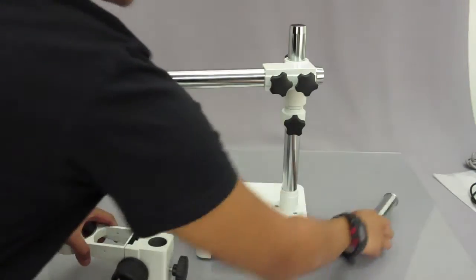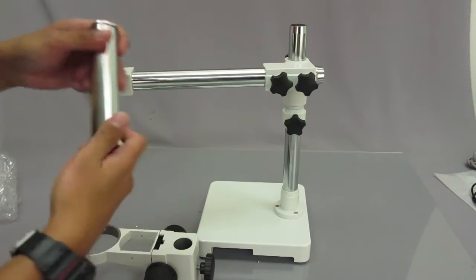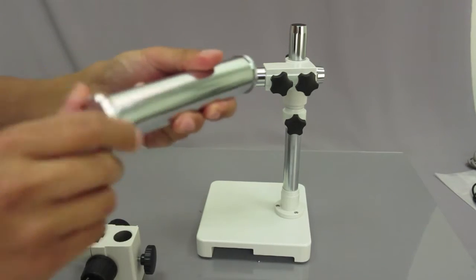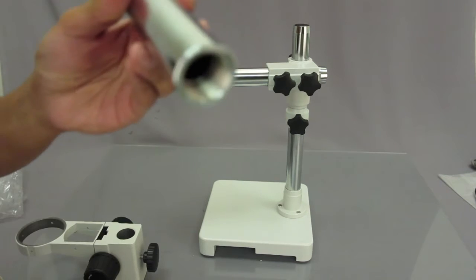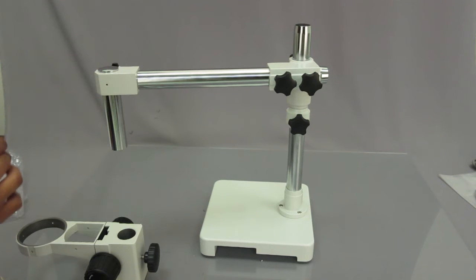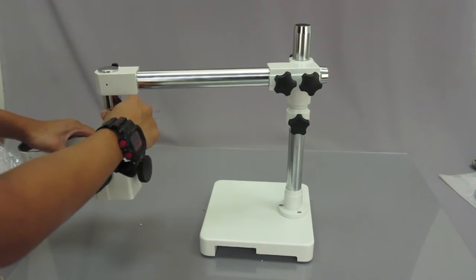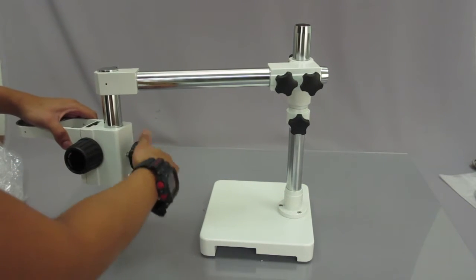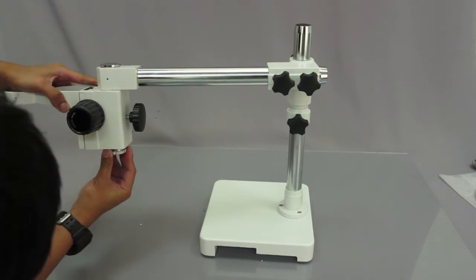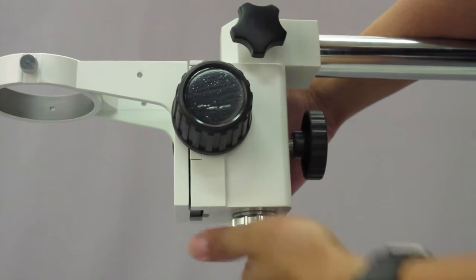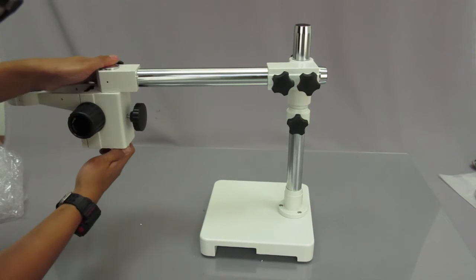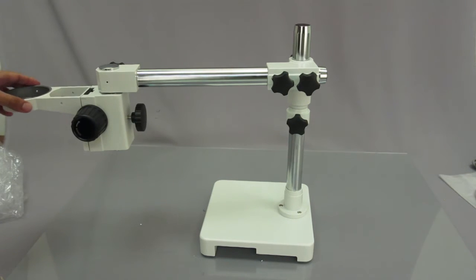So in order to put this, you need one of the other parts here. This is the part that holds it up right here in this direction. So what you're going to have to do is unscrew the bottom part. Just unscrew the bottom. So you see the ridges are gone now. So all you have to do is drop this in right there. And then go ahead, put the focusing rack on, put it up. Might have to make sure this is unscrewed a bit before you put it up. And then get the cap and screw it back in on the bottom. Make sure you put it tight so that it doesn't get loose or fall out.